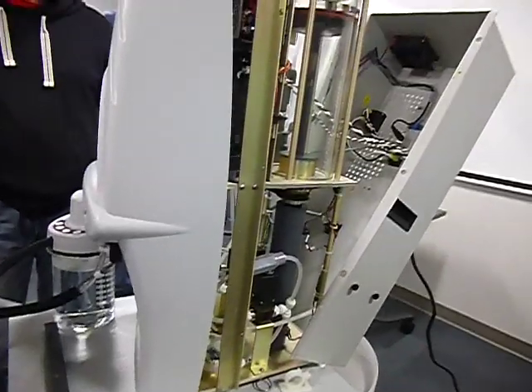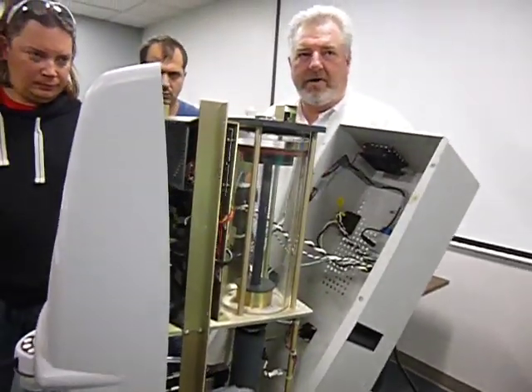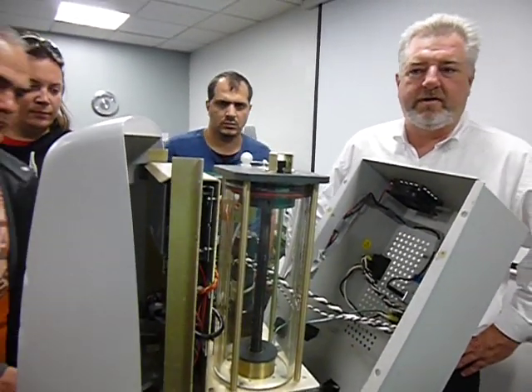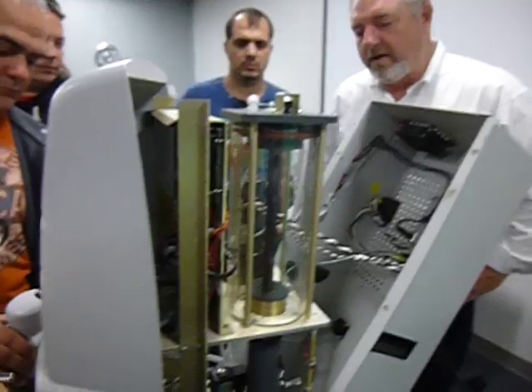All right. So let's go over a couple basics. You got the O-ring. Where's the O-ring at? Somebody point to it. All right. Where's the pressure and the vacuum switch? Over here. Okay. The main motor. Over here. Yep.